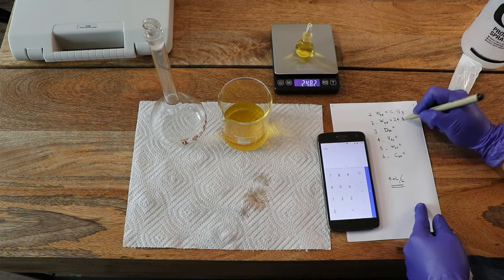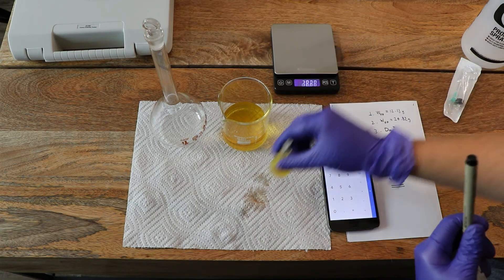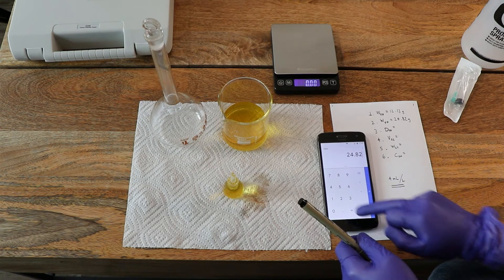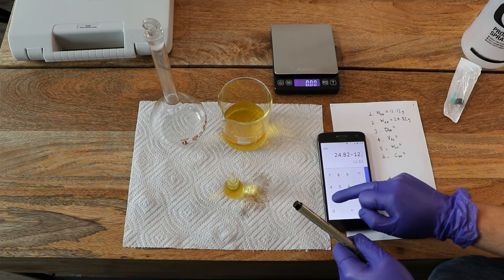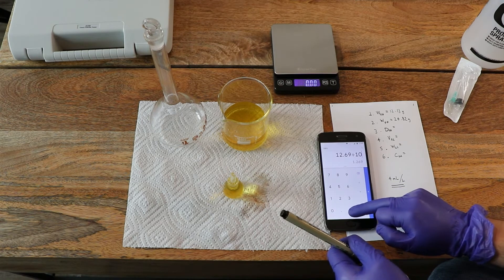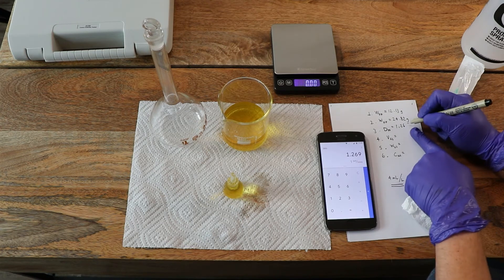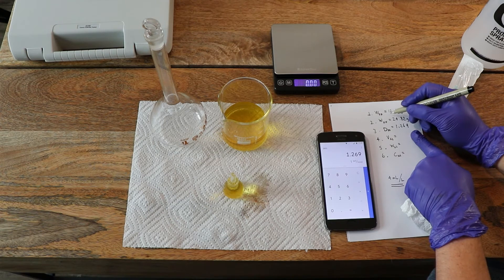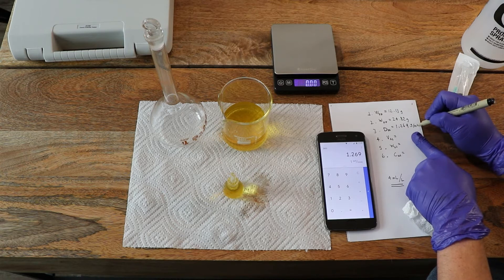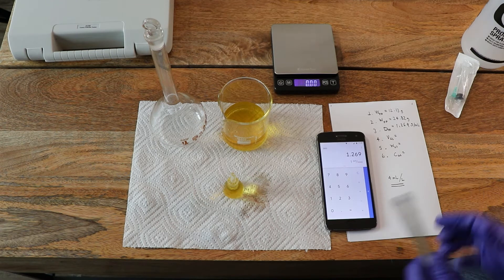The weight of the full pycnometer is 24.82 grams. The density is then very easy to calculate: it is just the difference between these two weights — 24.82 minus 12.13 — which gives 12.69, and now we divide by 10, which is the volume in milliliters. This gives us 1.269 grams per milliliter. So we have now calculated the density of the solution.